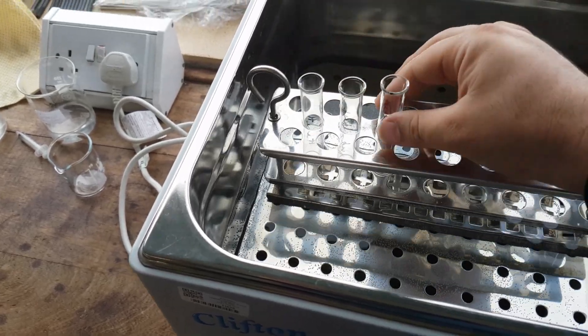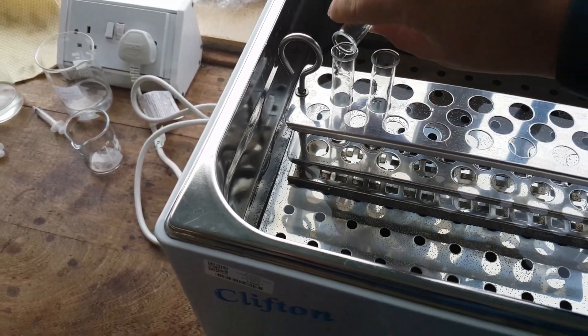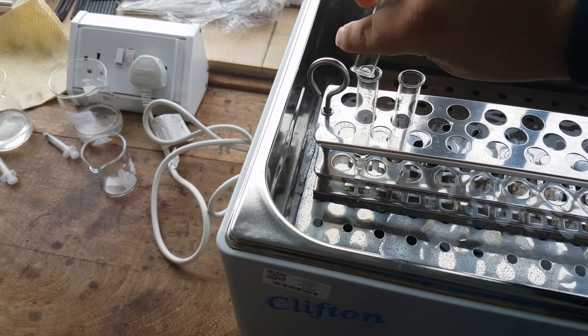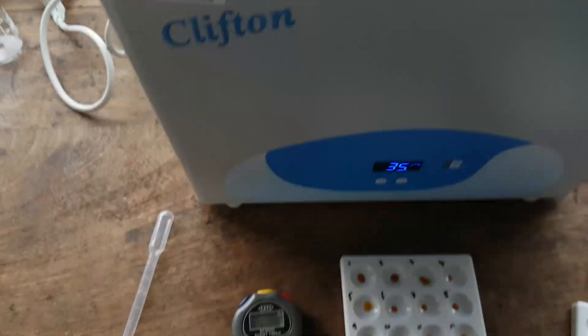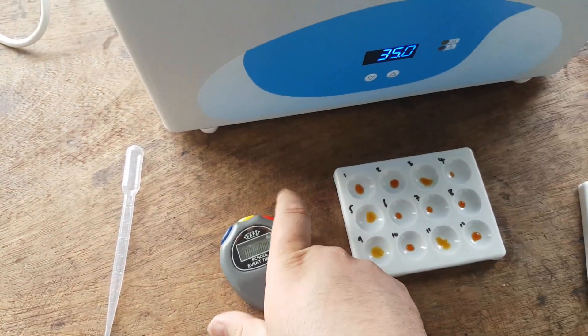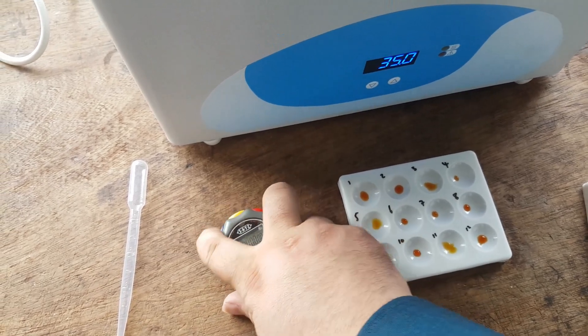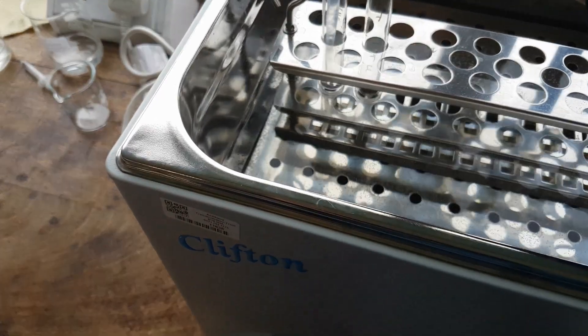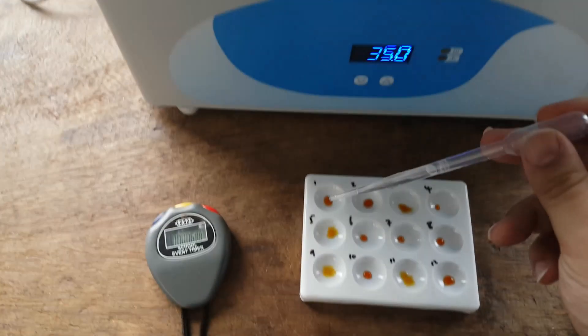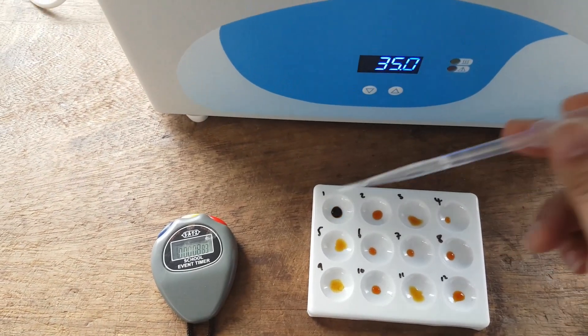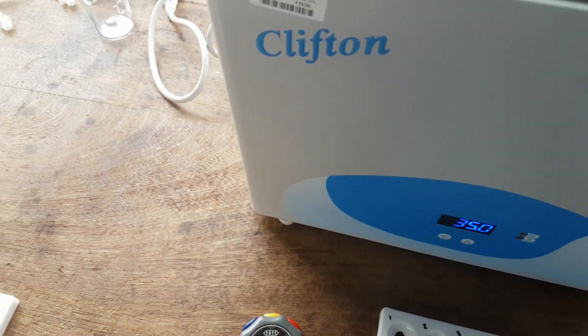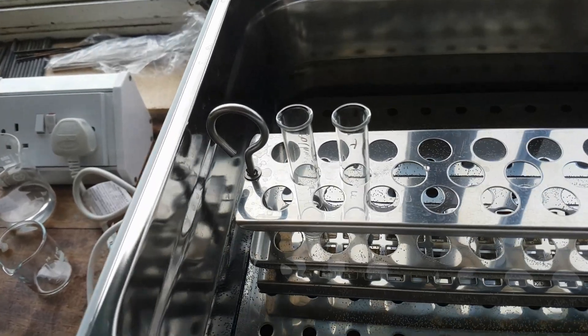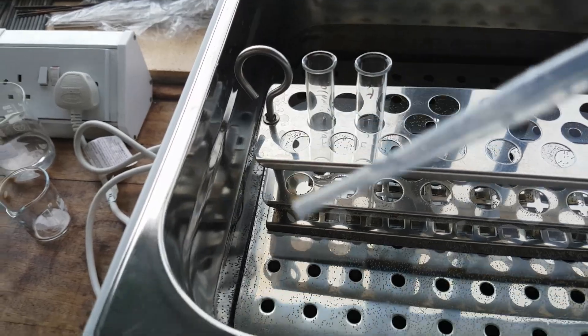Okay, so I'm going to do this one-handed best I can. So I'm going to transfer that into there. Excellent. I'm going to transfer this one into here as well. And I'm going to make sure that nothing leaves... Okay, so my stopwatch, I'm going to start straight away. So this is time zero. And I'm going to straight away take a little bit of that mixture from here and just place a dot in. Right, and that's gone black.